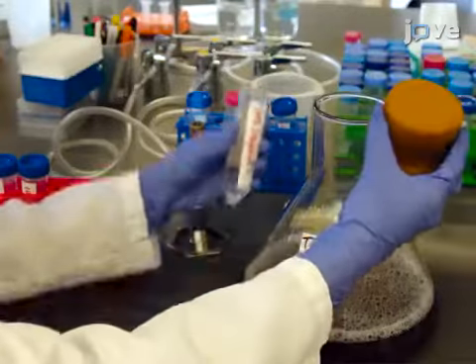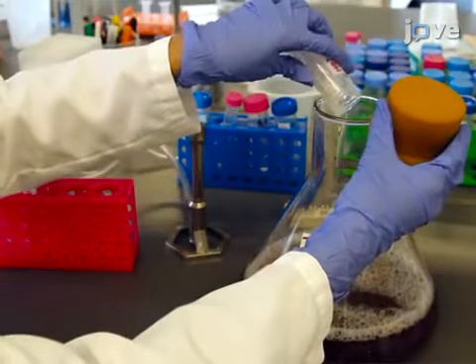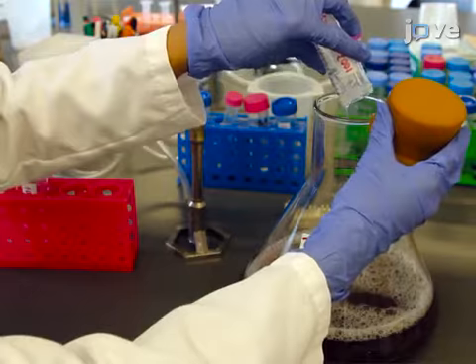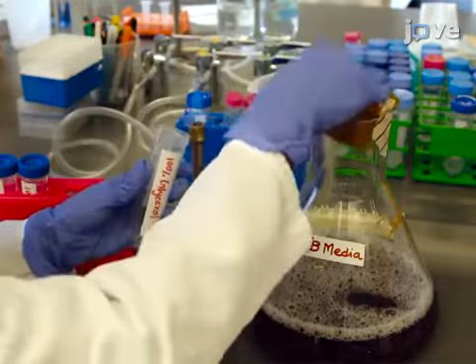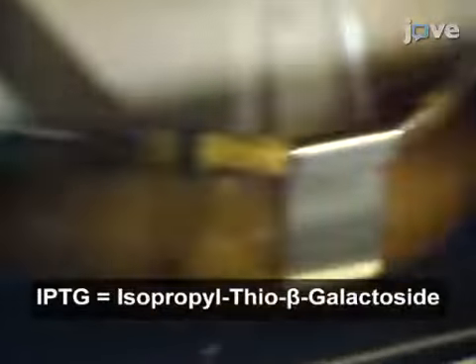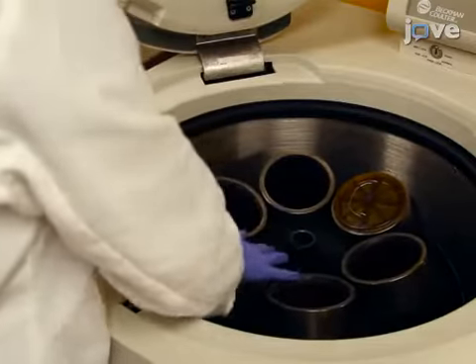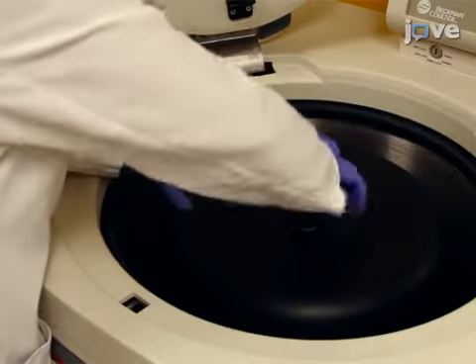Add 50 mL of glycerol and continue shaking the culture until the optical density at 600 nm reaches 1.0 to 1.2. After inducing the cells with 200 micromolar IPTG, reset the shaker back to 250 rpm and incubate further for approximately 16 hours at 18 degrees Celsius. Harvest the cells in 1 liter centrifuge bottles by spinning at 8500 times G, 4 degrees Celsius for 15 minutes.